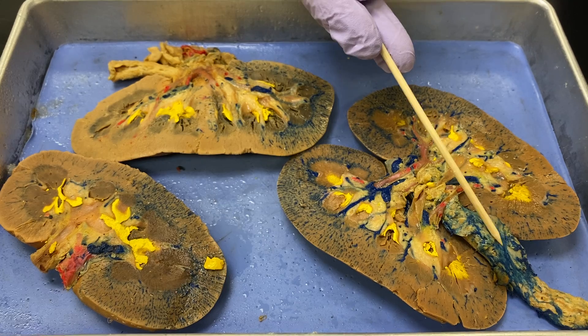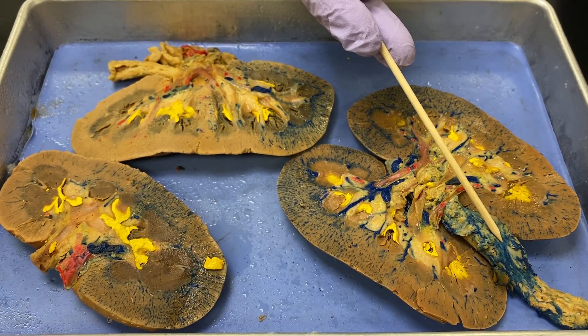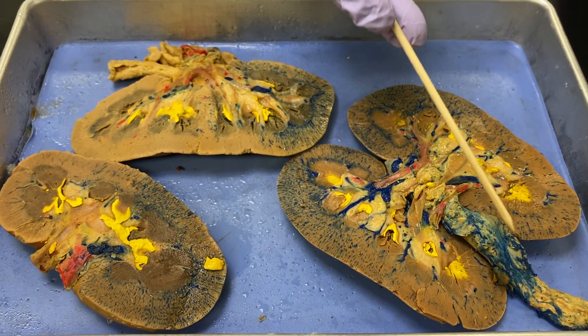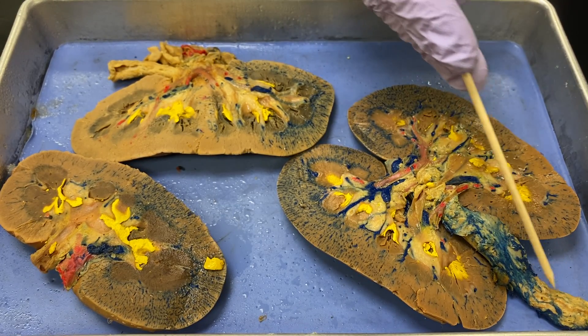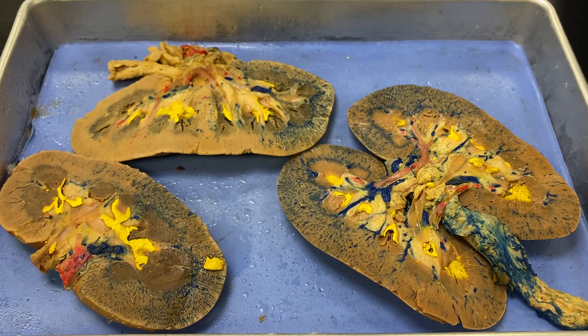Leaving the kidney is the ureter. This is the ureter. It's got a lot of connective tissue around it, but inside there is a tube that would carry the urine.